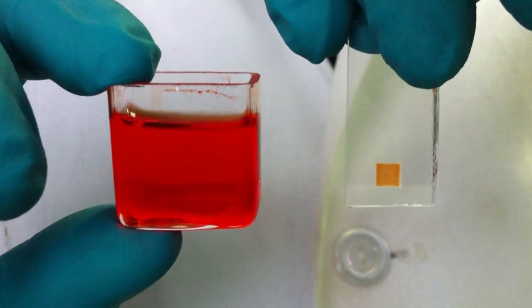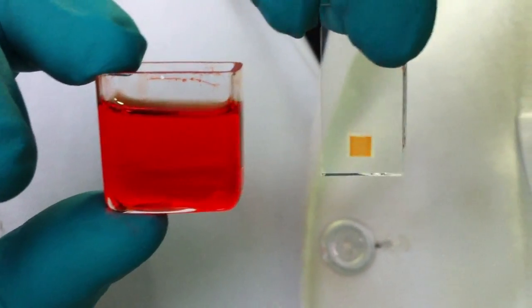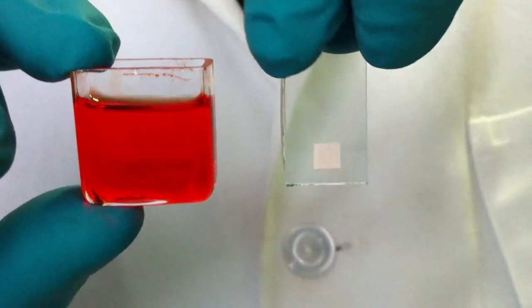Looking through the front side of our solar cell, we can see the brightly colored active area. This is because the majority of particles have been driven through the scattering layer and now reside in the mesoporous TiO2 support.